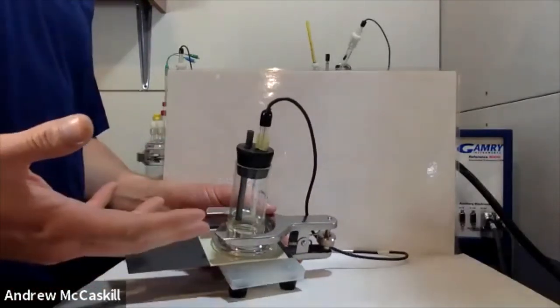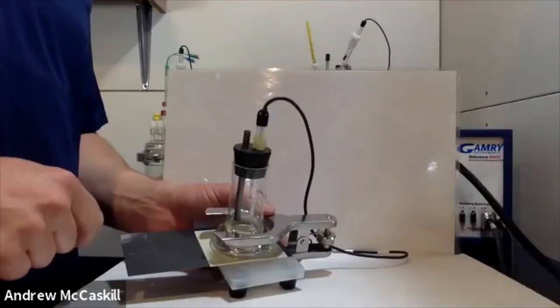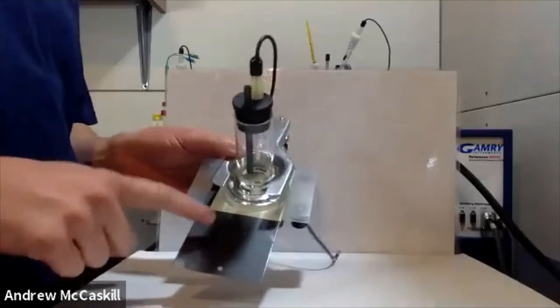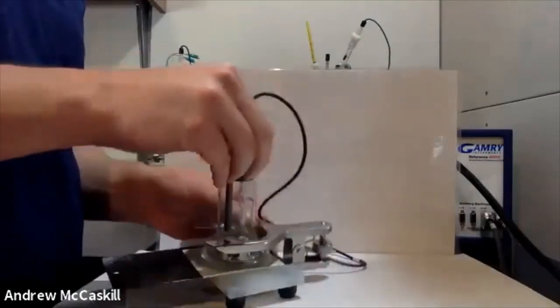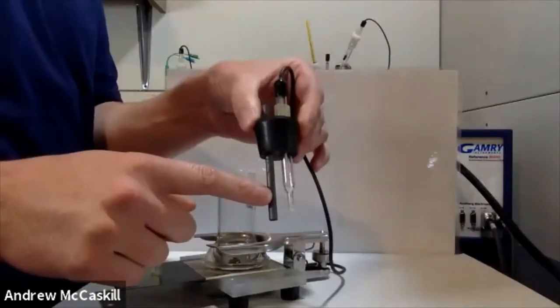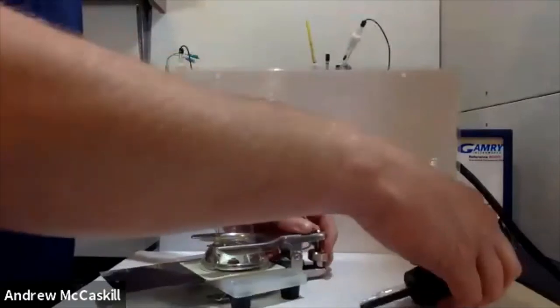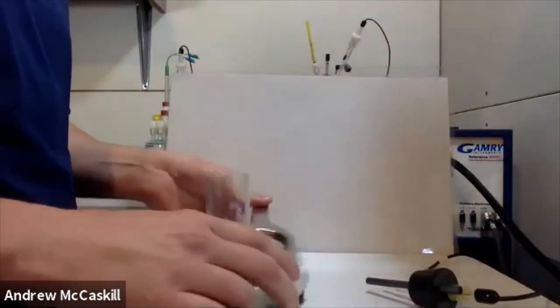In this case, our working electrode is the sample right here. We have our counter electrode and our reference electrode — those make up our three electrodes. Let me go ahead and pull this apart so you can get a better idea of how it's designed.